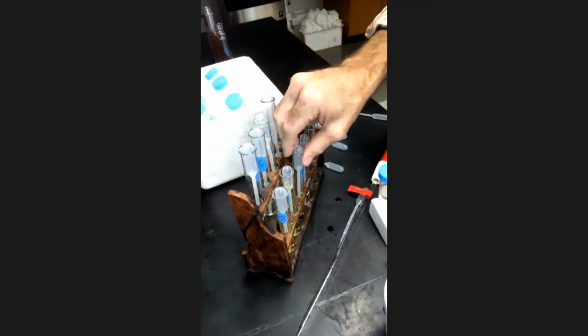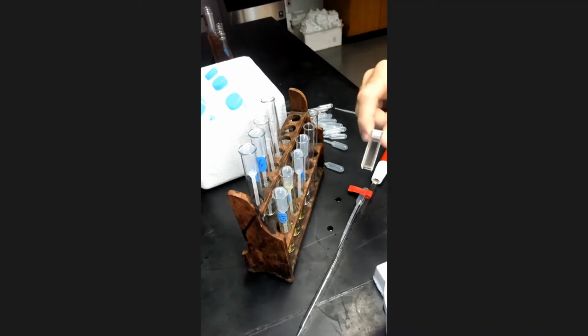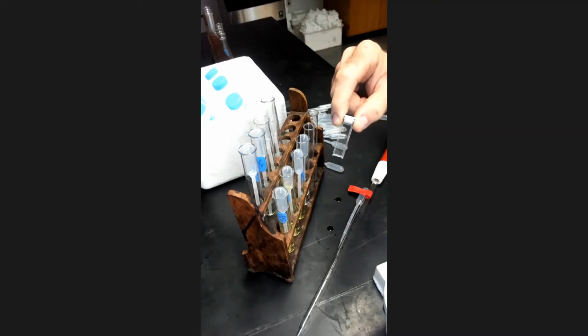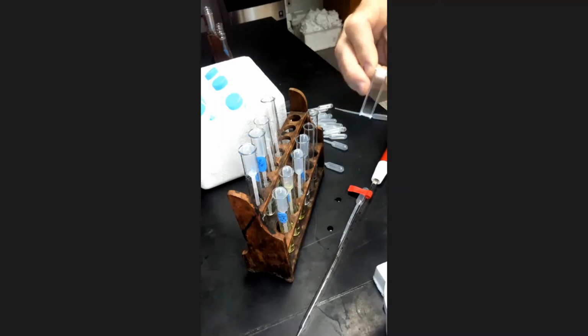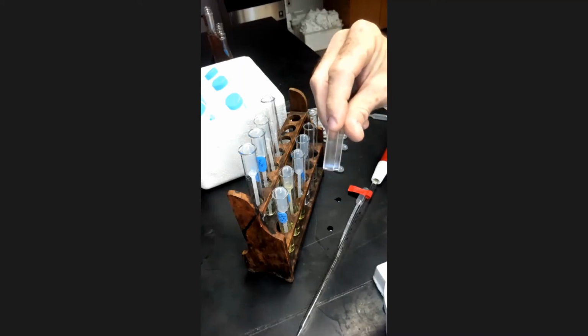As you can see, looking at these reaction tubes, they have a little bit of a yellow tint to the solution, which again is an indication to us of how much of the reaction has proceeded. Now I'm going to be using these cuvettes to transfer the reaction solutions into and measure the absorbance, which essentially quantifies exactly how yellow each tube is. As you look at these little cuvettes, you'll see that two sides are clear and two sides are ridged.